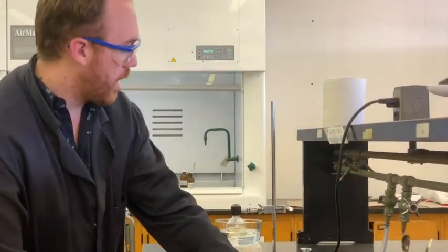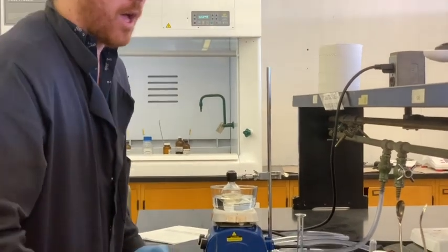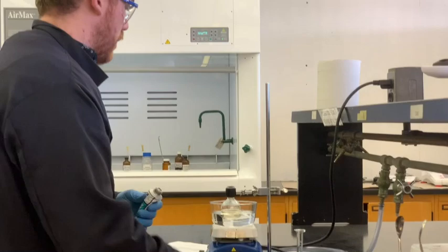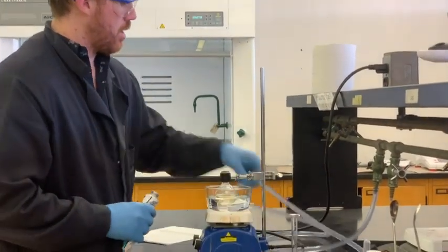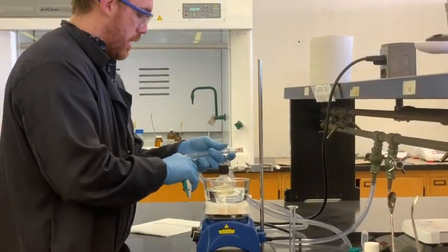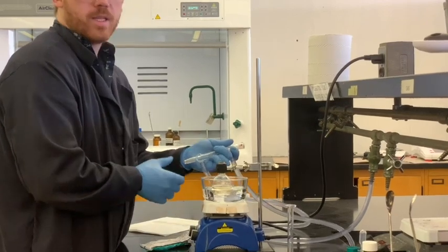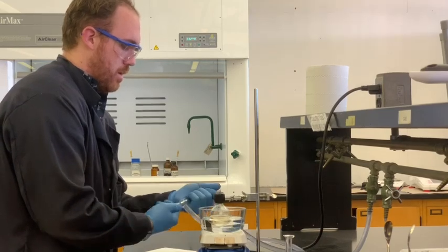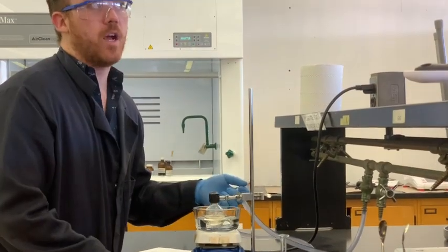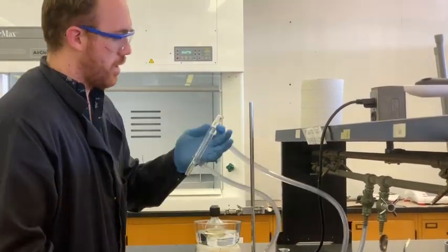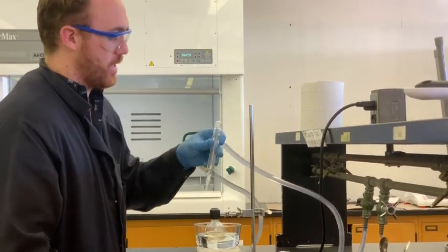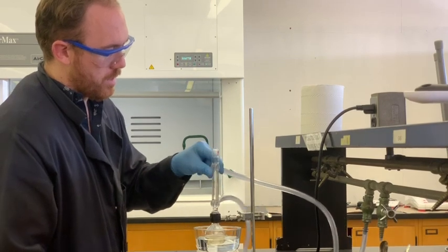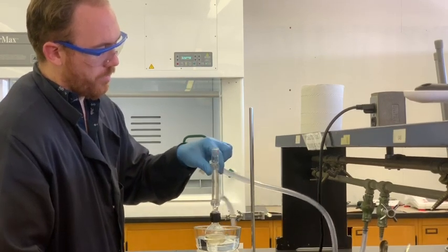So while we're waiting for the 2-naphthol to dissolve, what I'm going to do is take a little bit of this grease and grease the joint here. Just touch it a tiny little bit. Usually you don't need that much anyways, it's just a mess. Cool, fits perfectly well there.